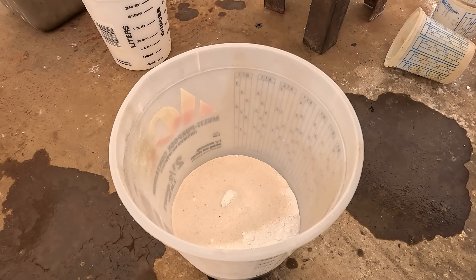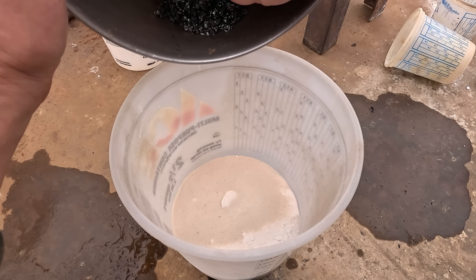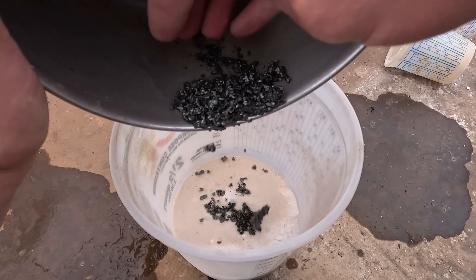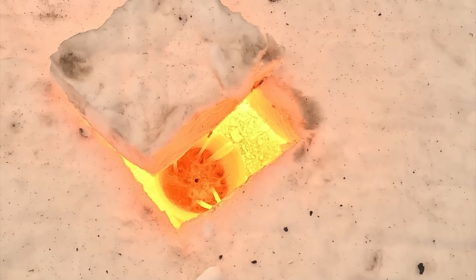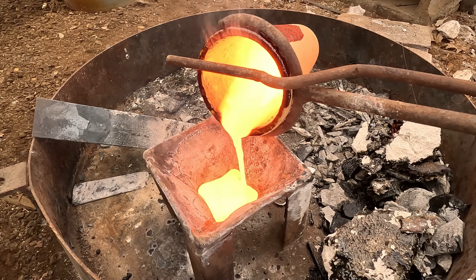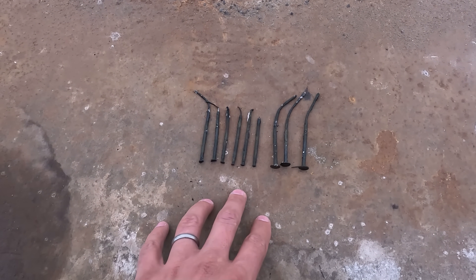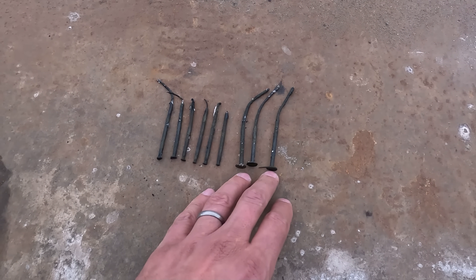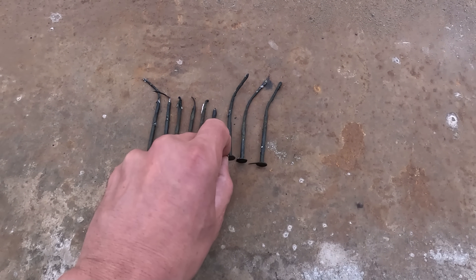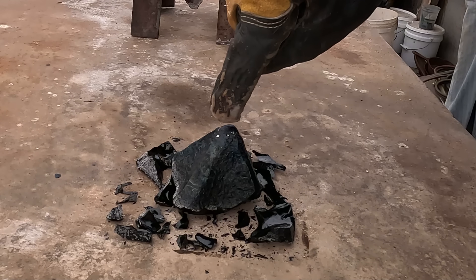Looks like that worked. We've got 100 grams of anhydrous borax, 100 grams of soda ash, and 50 grams of silica sand. I'm adding our granulated iron-silver matte. I'm actually kind of encouraged that all the silver is gone from the matte, because that probably means it's collecting the platinum as well. Now I'm going to smelt this back down with iron nails to reduce the silver back to silver metal and turn the iron matte into FeS, which should be absorbed by our soda-ash-rich slag. Before we look at the slag — the nails I put in: I initially put in six, then added three more about 20 minutes before I poured, and they're not eaten at all. I have a good feeling about this — when I poured I thought I saw a little glob of metal come out.